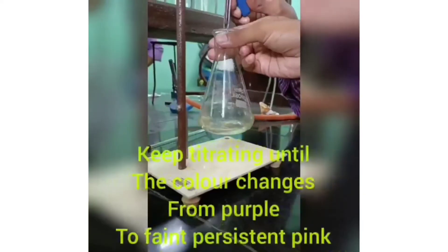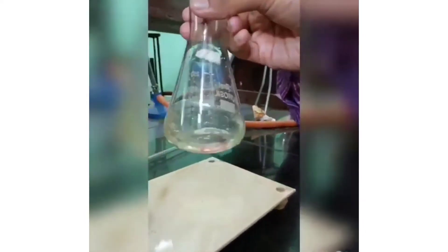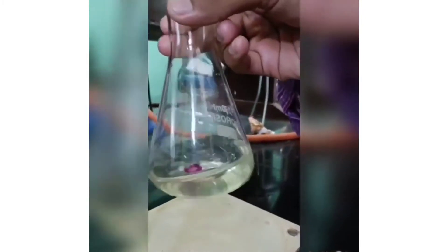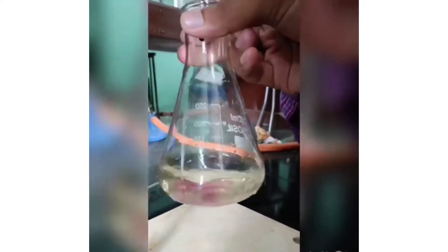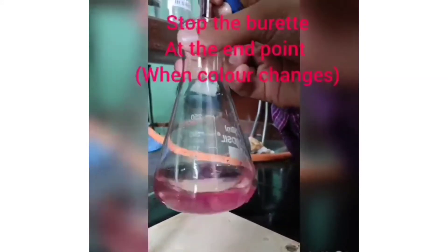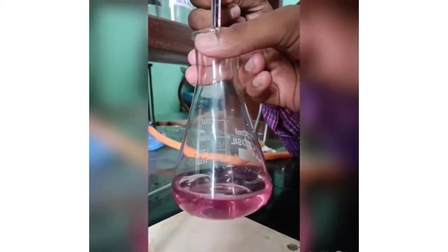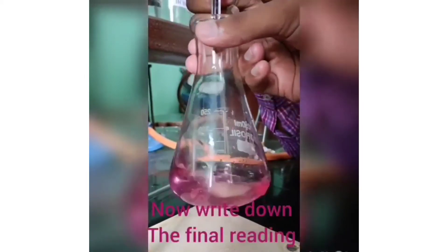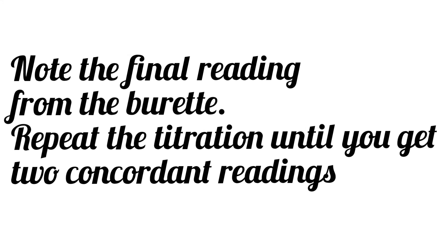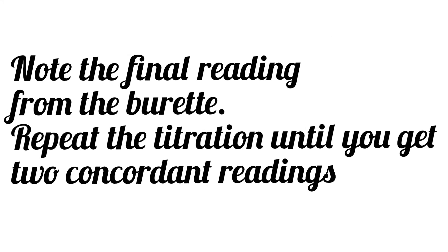To assure that the reaction is taking place accurately, permanganate ions appear to be colorless when they come in contact with the solution in the conical flask. But as the final drop is added, a faint pink color persists, and this indicates the end point of the titration. Note the final reading from the burette and repeat the titration until you get two concordant readings.